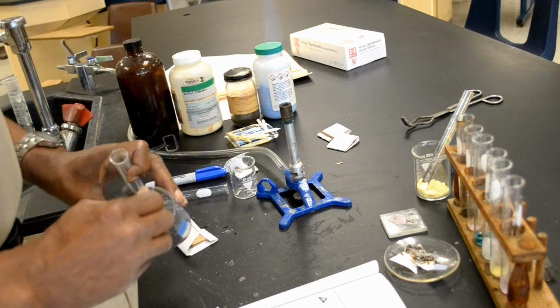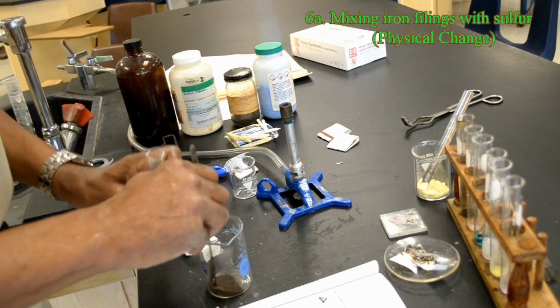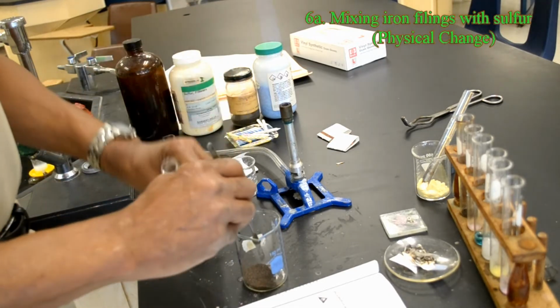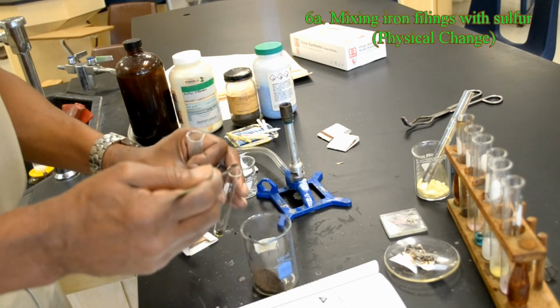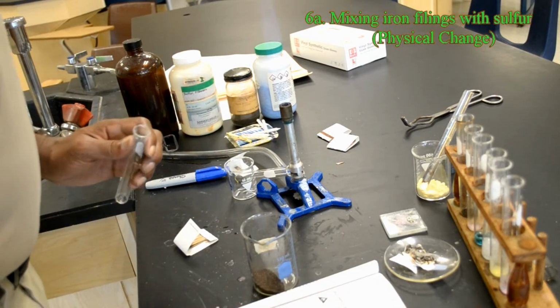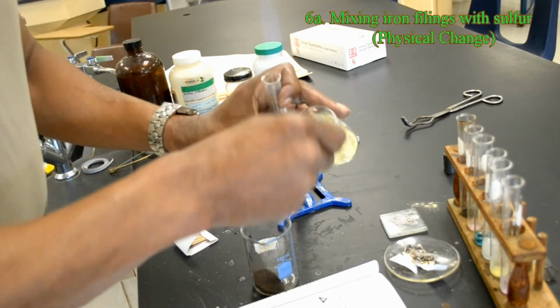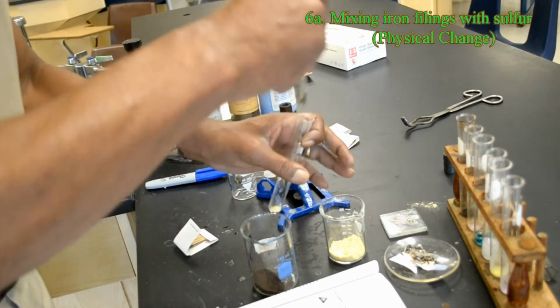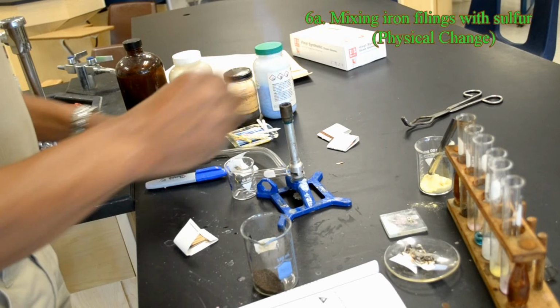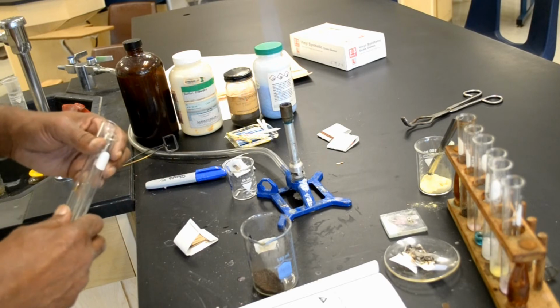In the next step, we'll use a laboratory balance to measure out 0.5 grams of iron filings into a test tube. So without a balance, I'm going to say that this is about 0.5 grams. Then I'm supposed to add 0.5 grams of sulfur powder to another test tube. And I'm going to say that that's about 0.5 grams. Then I'm supposed to test each sample with a magnet.